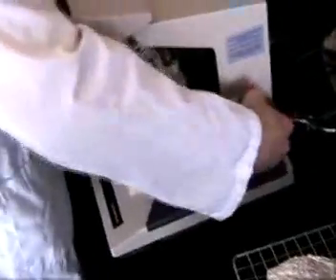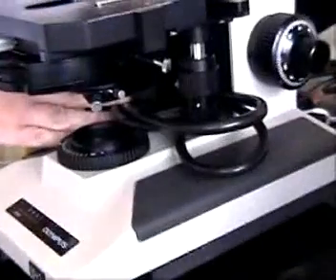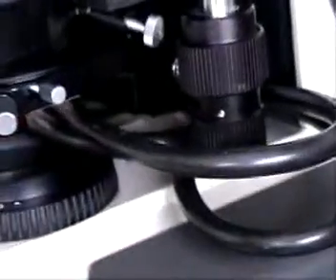Now remember, when storing your microscope, you need to make sure not to wrap the cord around the microscope but instead to store it underneath the stage.